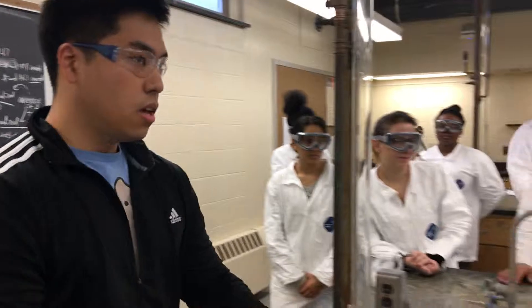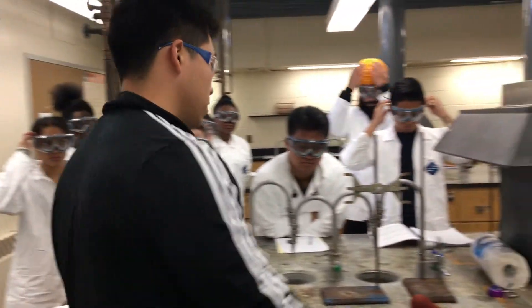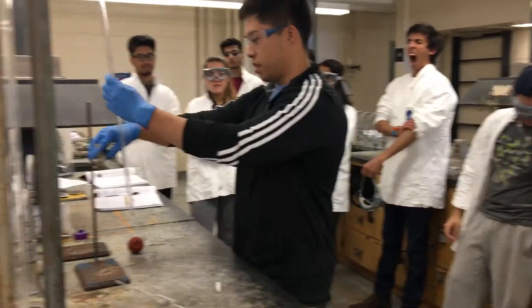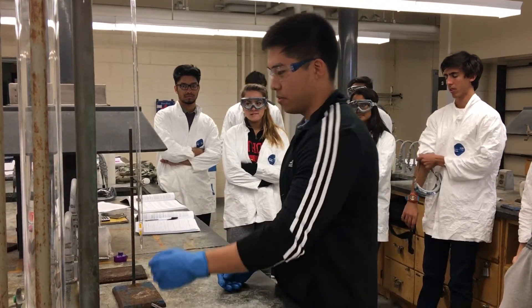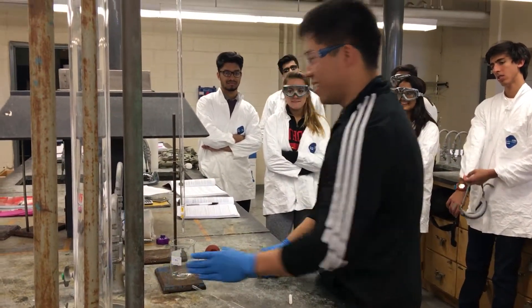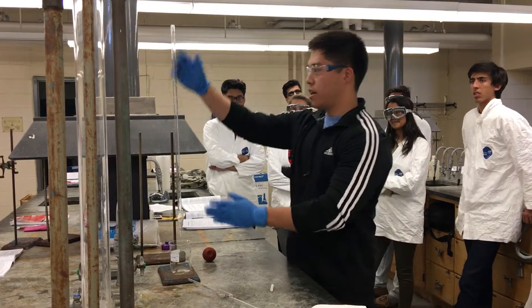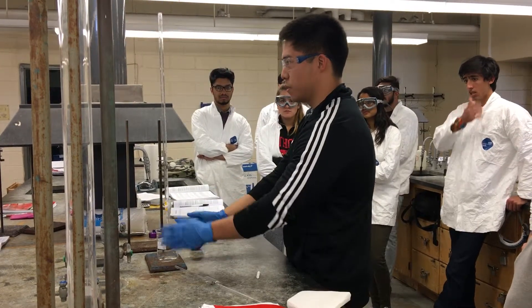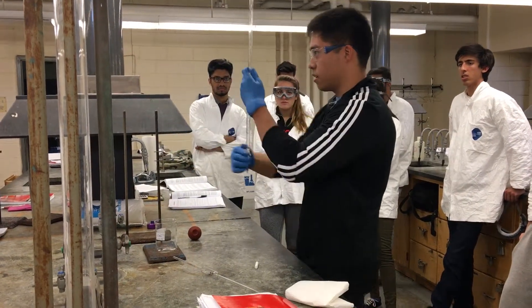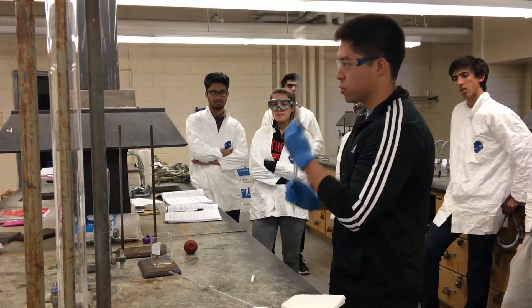Move back and I'm going to demonstrate. You guys probably already know this from last week's lab, and all sanitary procedures still apply. To wash your burette: make sure it's in the off position, add about 10 to 15 mL of DI water, squirt about 1 mL out into the small beaker, then unclamp your burette, turn it horizontal, and twirl it around as the water moves through. I suggest you do that twice to make sure it's absolutely clean.